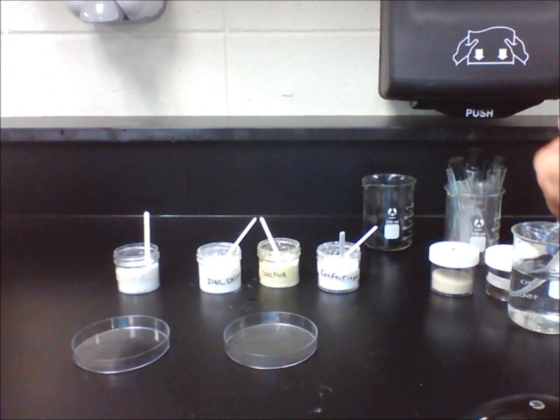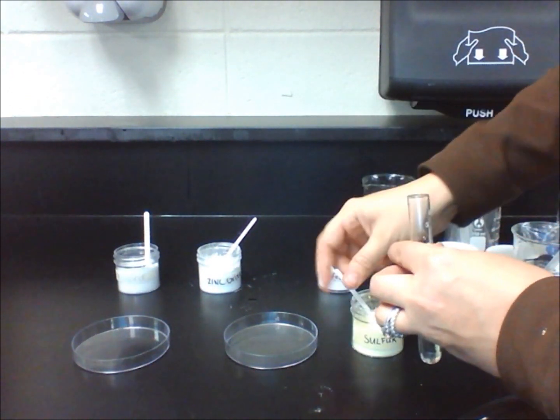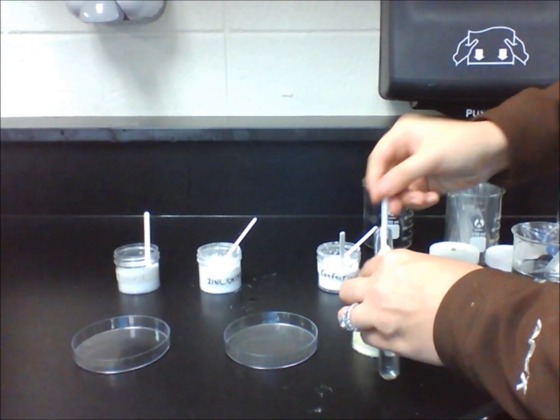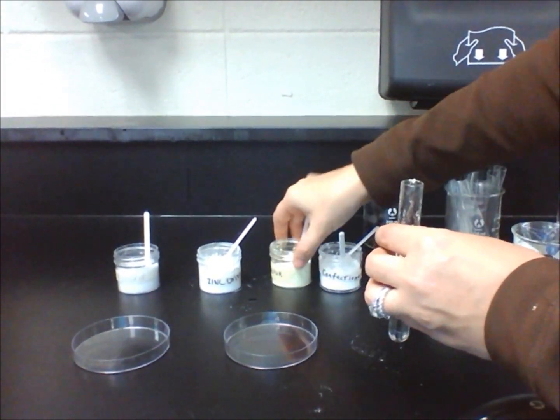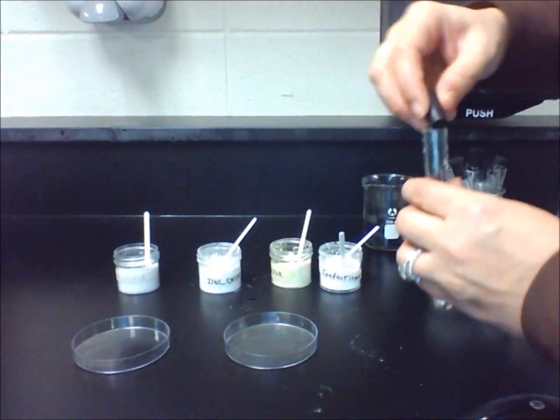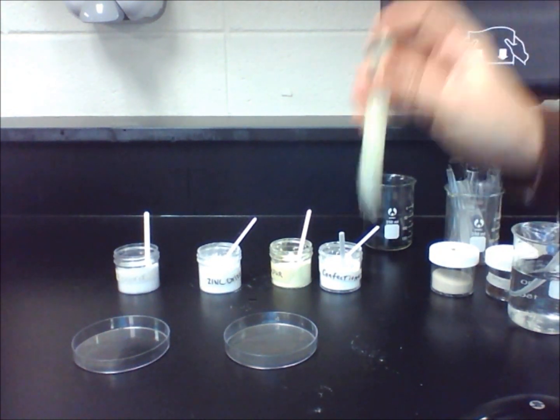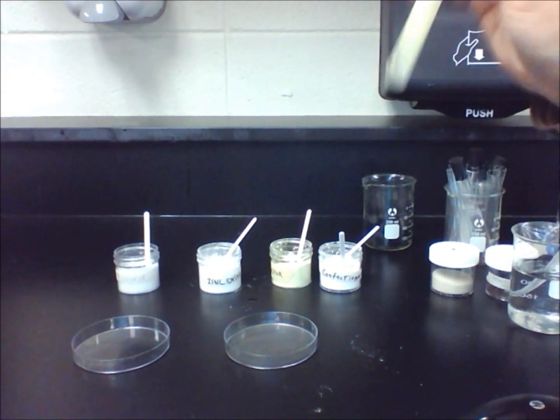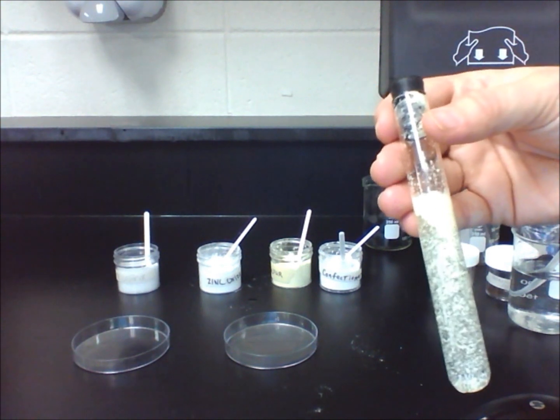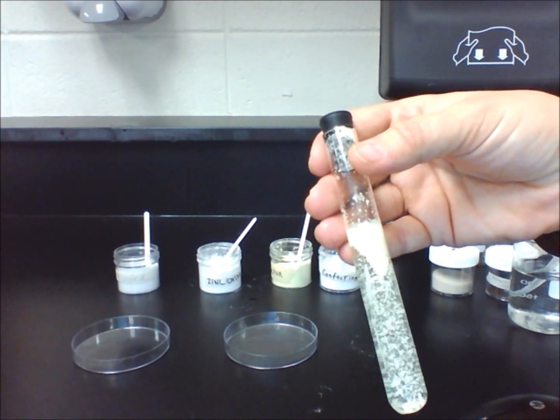After putting a lab scoop of sulfur, you will notice that it does not dissolve in water. Some of the substance stays at the bottom because they are clumped together, and some of it floats to the top, but none of it disappears. The same amount of sulfur is visible in the test tube. Therefore, this substance did not dissolve in water.